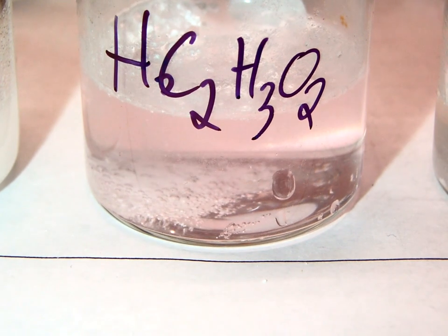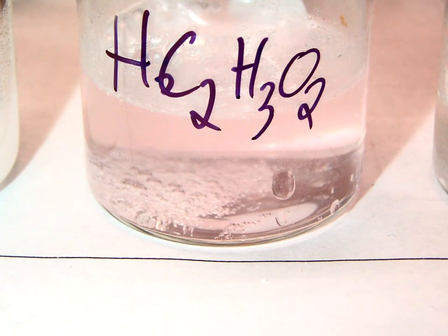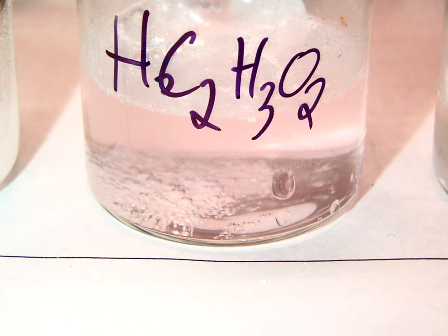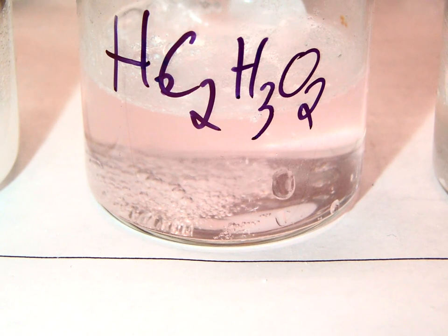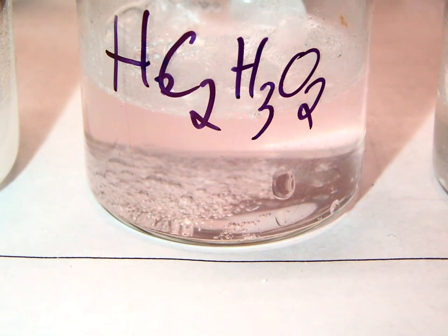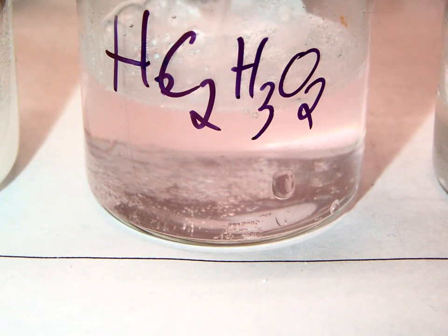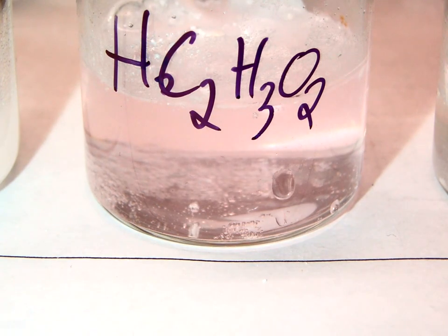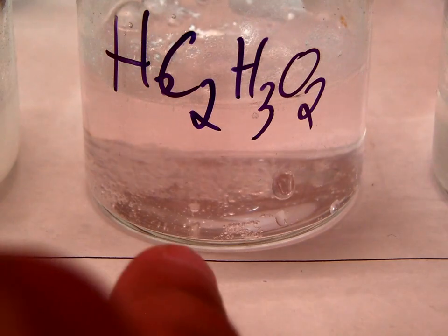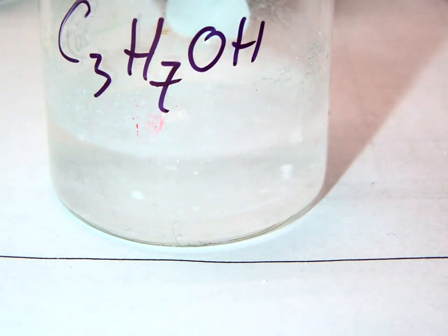Now, what we can see in here is that there is a slight amount of bubbling happening. So we're going to add just a little bit more vinegar to it because it might have gotten dilute. So if we add some more vinegar, we can see forming down here at the bottom, there's some slight bubbles. And then if we swap for our rubbing alcohol, we can see that the calcium carbonate just falls to the bottom.